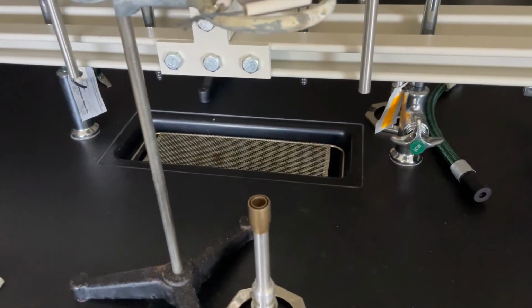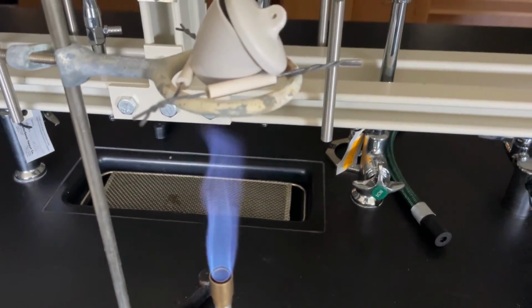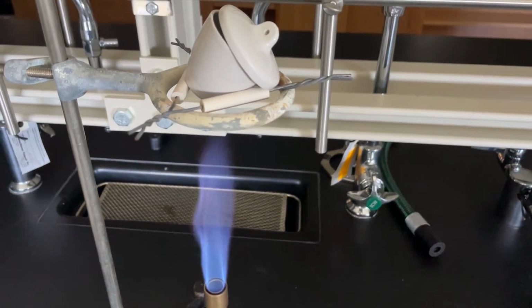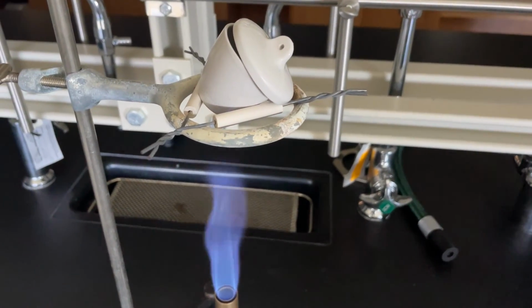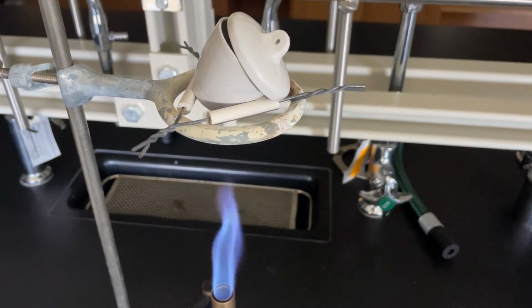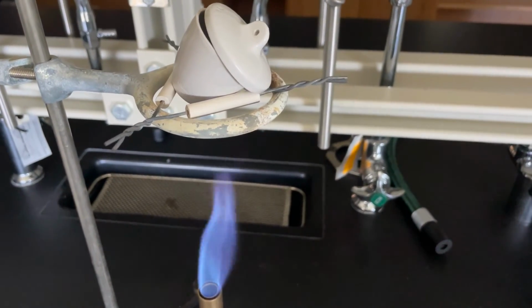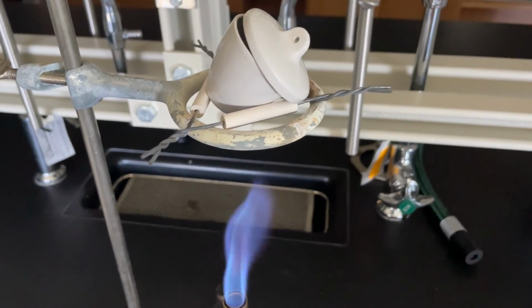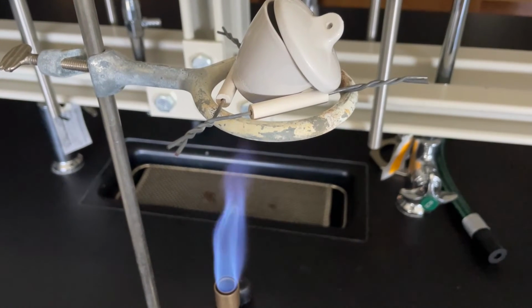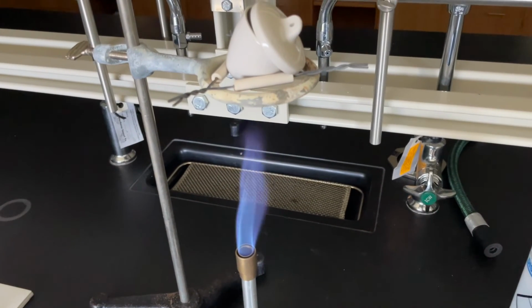Remember, our products for this chemical reaction were carbon dioxide gas, which we just released. You saw all of the bubbles. Plus water in a liquid form, and then sodium chloride acting as our halide. And so we want the sample of just the halide, so we're going to begin heating to remove the liquid H2O. And this is a pretty long process, so we continue to heat.